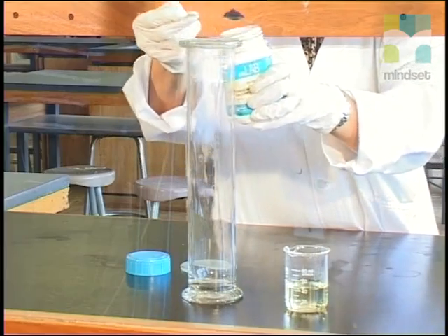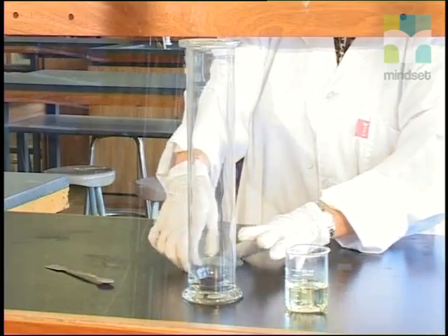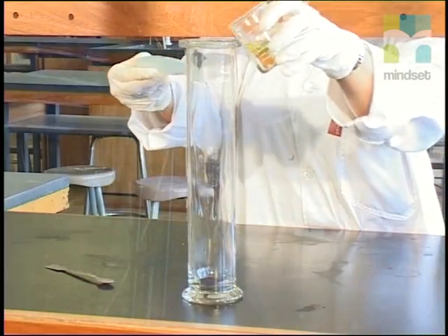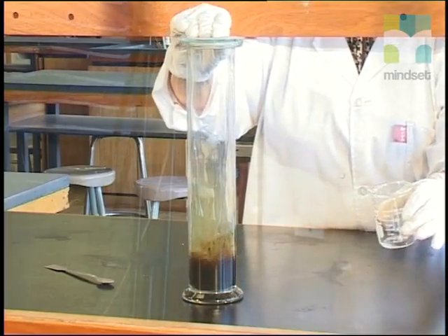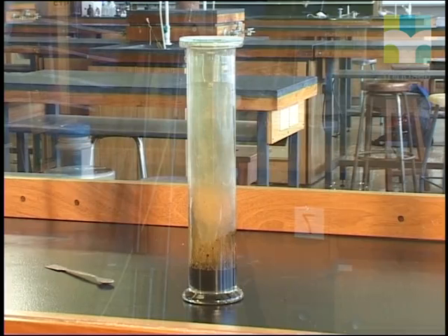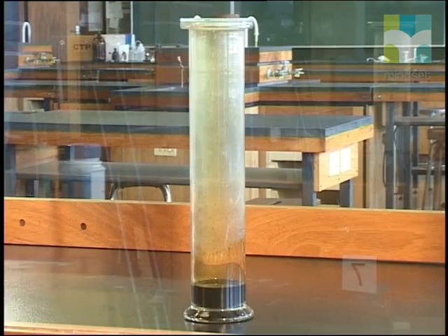Now let's begin. Place some potassium permanganate powder in the gas cylinder. Now add a small amount of warm concentrated hydrochloric acid to the powder and cover with a greased cover slip. Do you see any change? You should also notice that a greenish-yellow gas has formed.